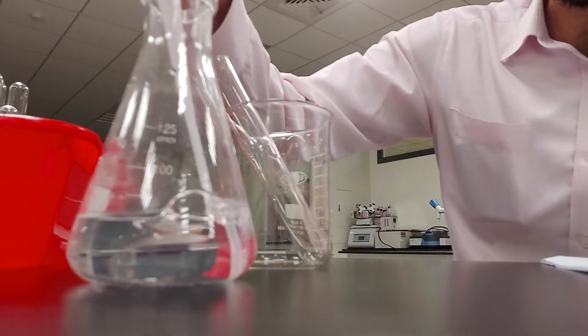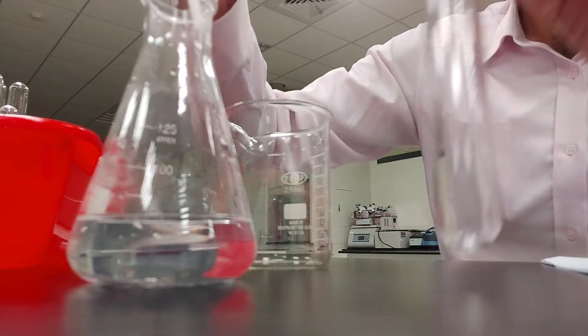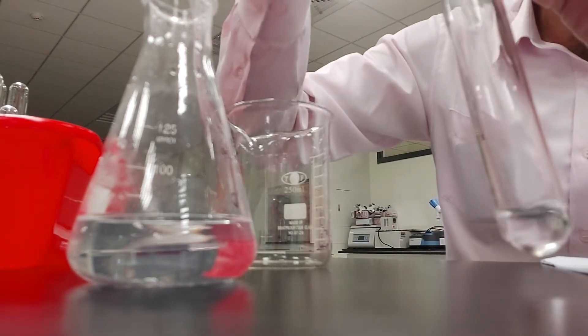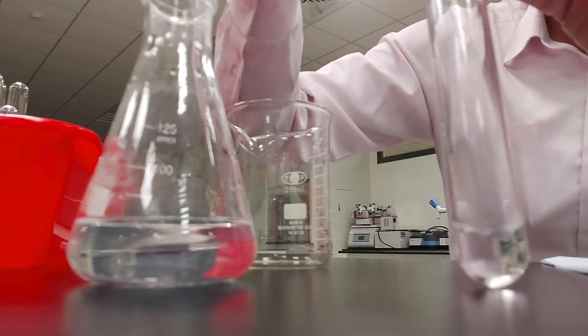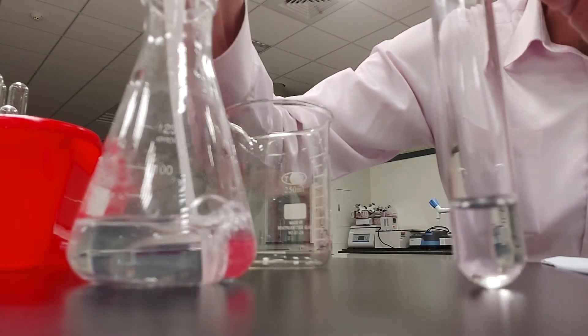All right, station number three. So this time we're going to get some hydrochloric acid. I'm going to add it to the test tube until it's about halfway full.